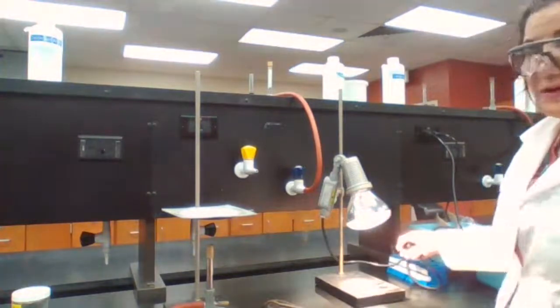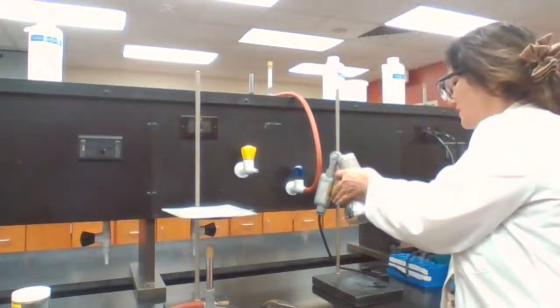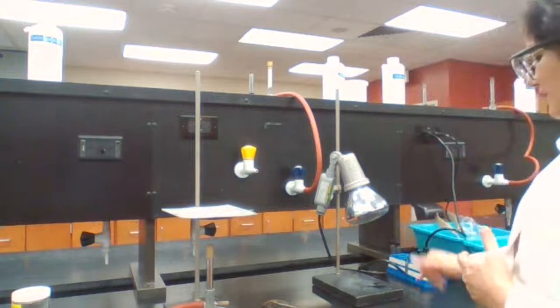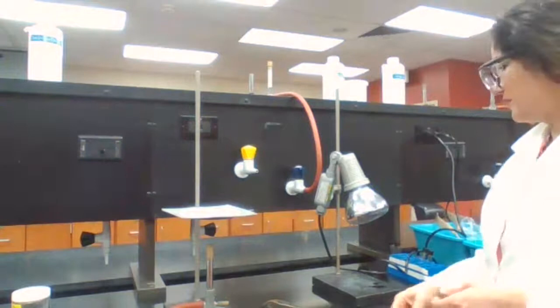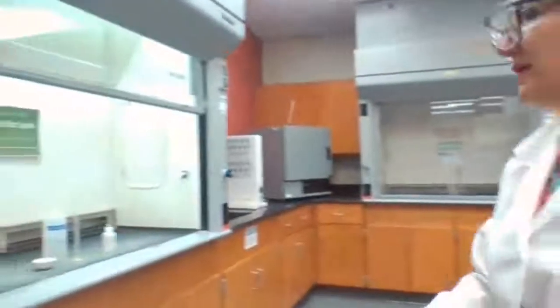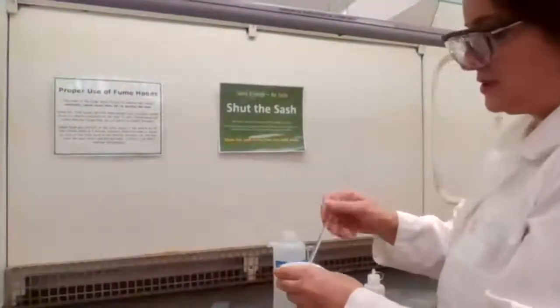When we get the zinc separated from the solution by decanting or filtration, we are going to place it underneath the heating lamp and evaporate it. To clean this so it doesn't get stuck to the bottom of the evaporating dish before I use it. So my equipment is ready for the next step, but I need to check and make sure the chemical reaction is taking place. This is a long reaction. It takes very long time. It's a slow reaction because it's just the aqueous solution.